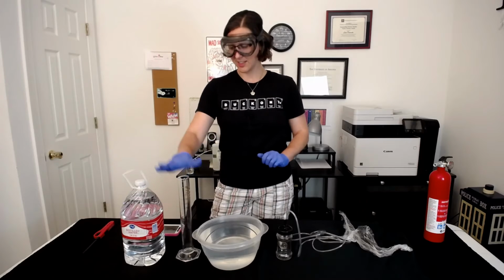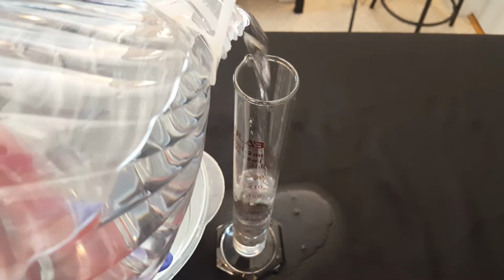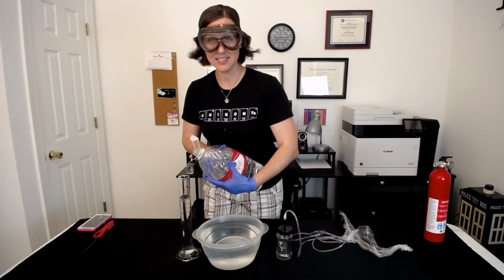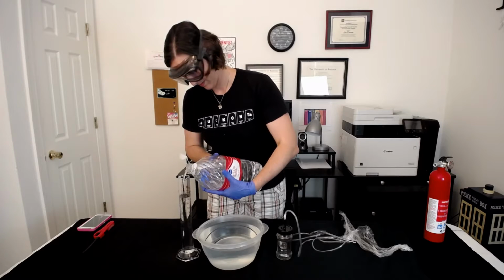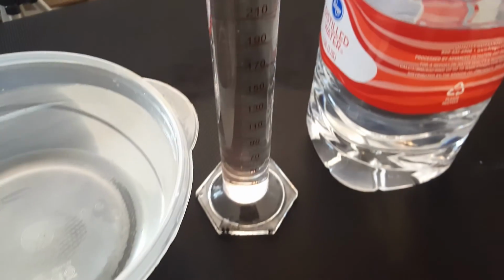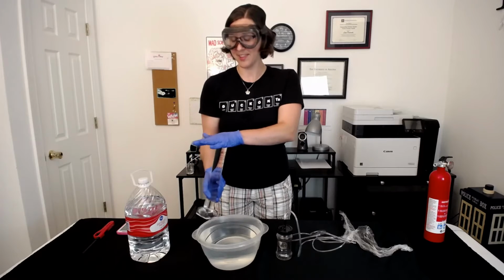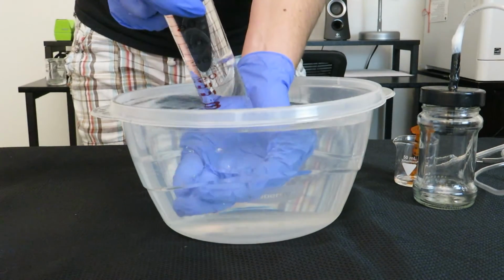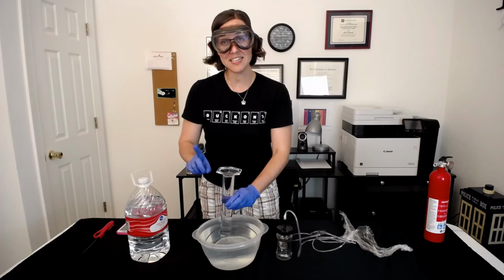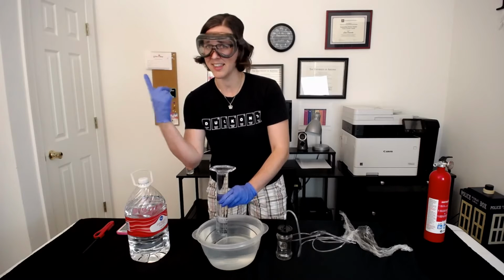So first things first, let's fill this guy up with water. Fill this all the way up to the tippy top, past the graduated cylinder mark. The next thing we have to do is seal the top and invert this guy into our water bath. There we go. The better the seal, the less air we get in the graduated cylinder, which is the goal, because we want to collect hydrogen gas, not the air around us.